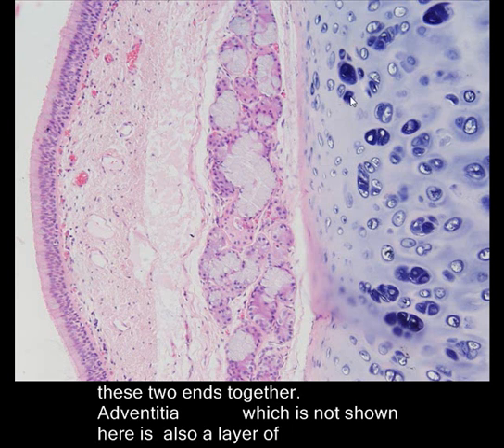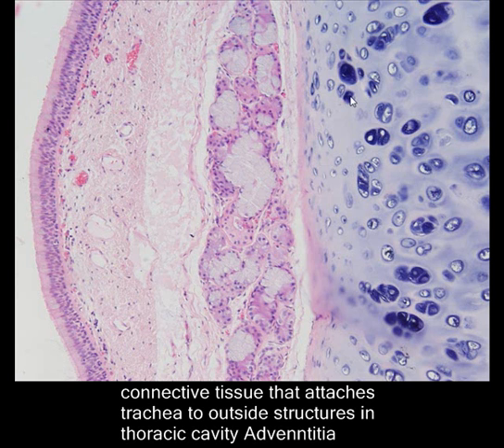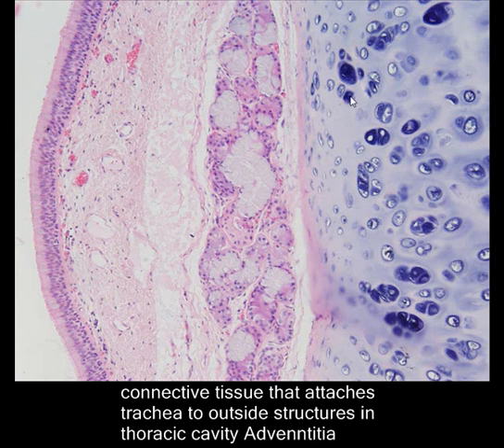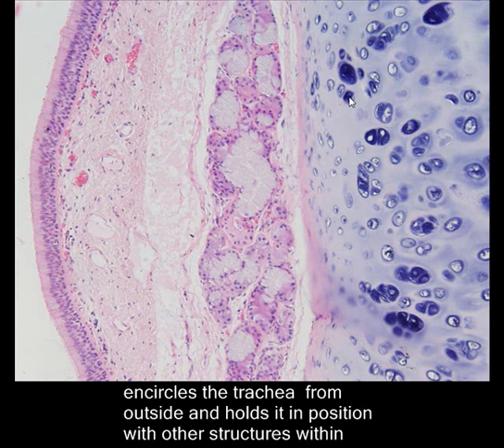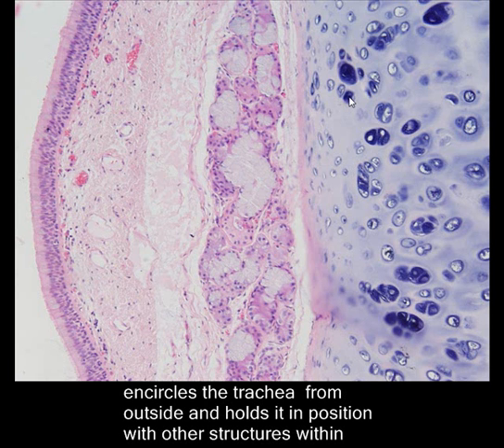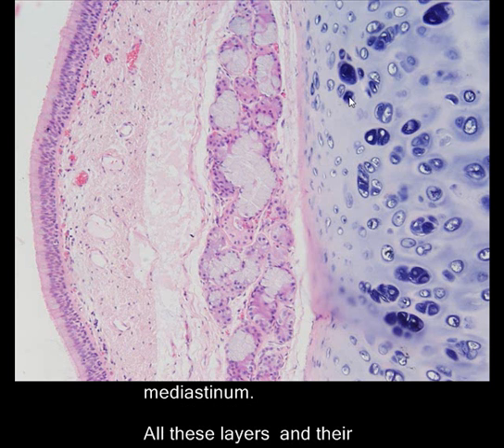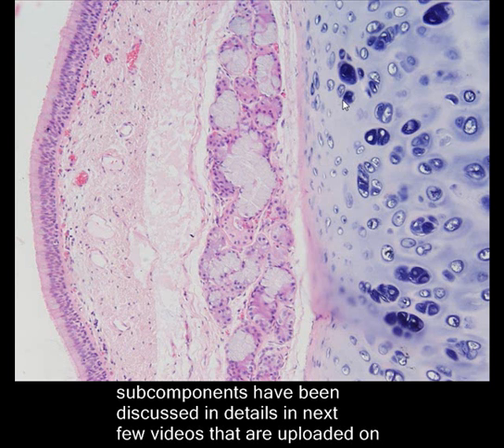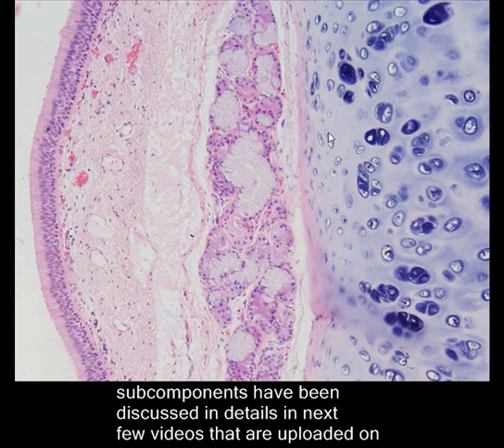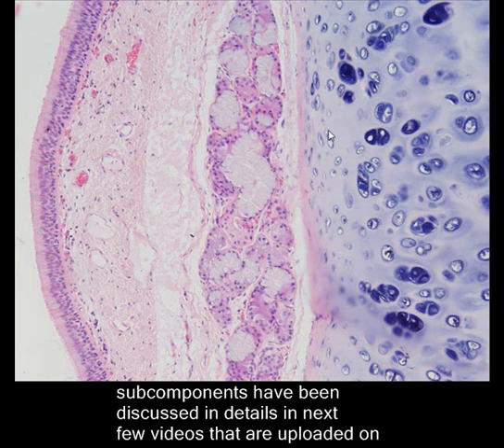Adventitia is not visible here, but it is also a layer of connective tissue that attaches the trachea to the outside structures of the thoracic cavity. Adventitia thus encircles the trachea from outside and holds it in position with other structures within the mediastinum.